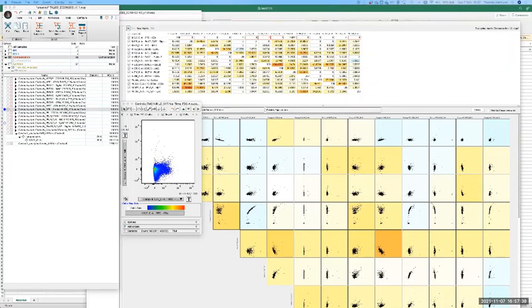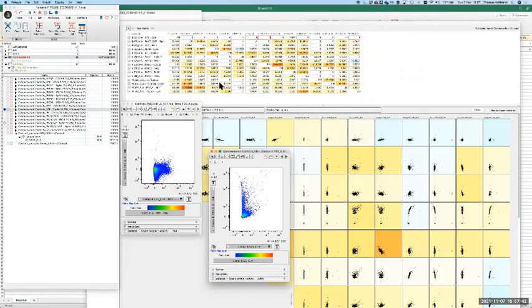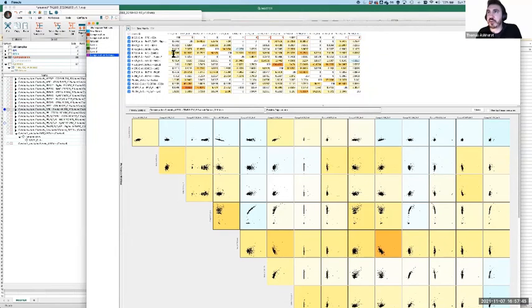Well, at least you got the channel there. I think that value is just an error, because I don't have much live dead stain in this case. It's probably because of where you put the negative and the positive on the FITC, it's probably confused. Regardless of where I've set the gates, it only contributes to the row, not to the column. Some of these other values are unexpectedly high, so I'm just going to assume that the zombie is messed up. It should not be that high in the BB510 channel. So I'm going to assume there's something wrong with my live dead in this case, but the rest of that column looks good.